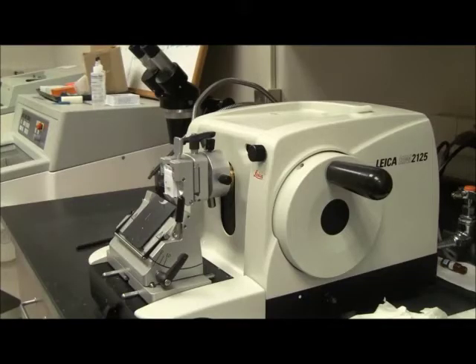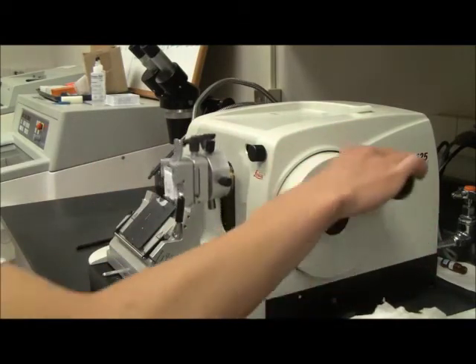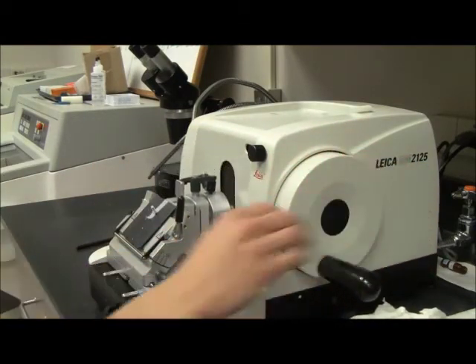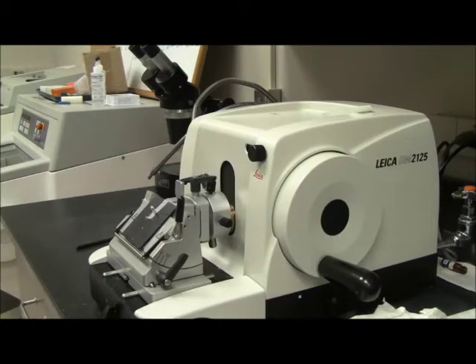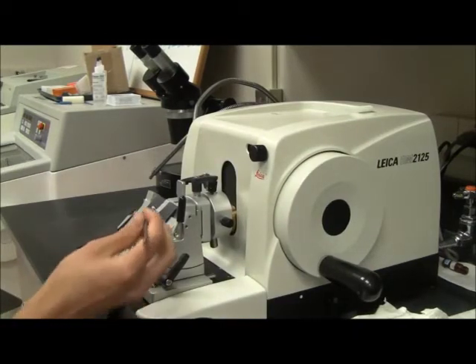Cut strings of six or so sections. Using forceps, carefully place them in a hot water bath. Two of these strings will go on each slide.